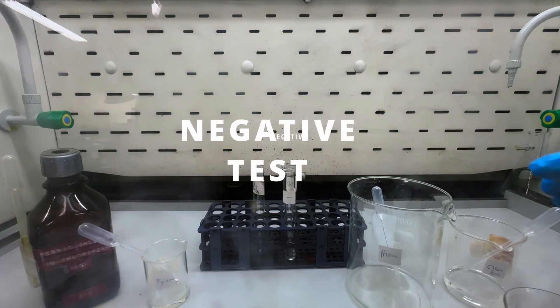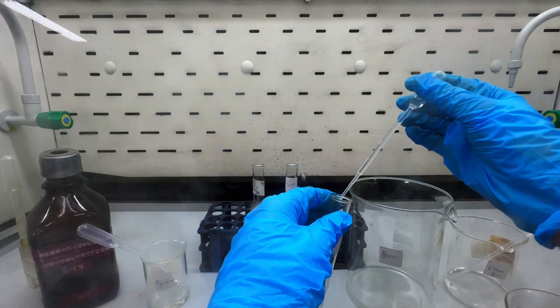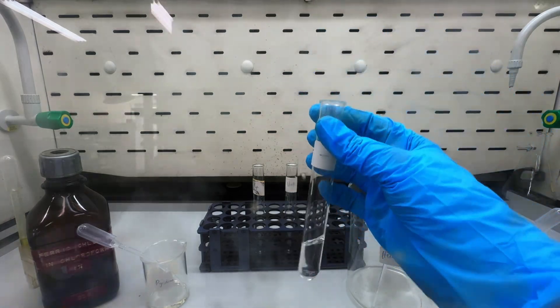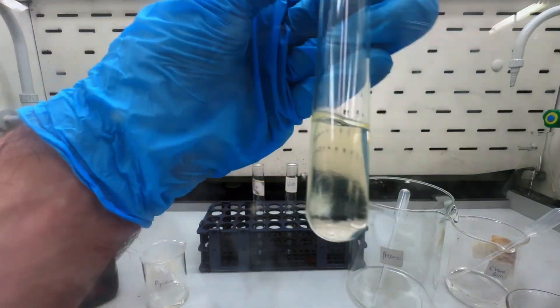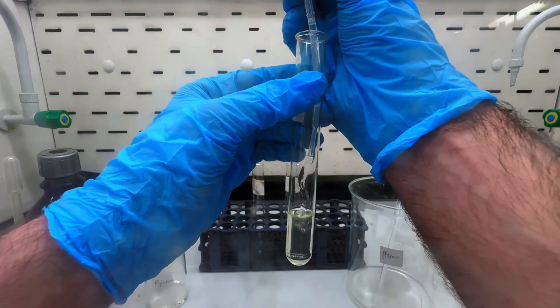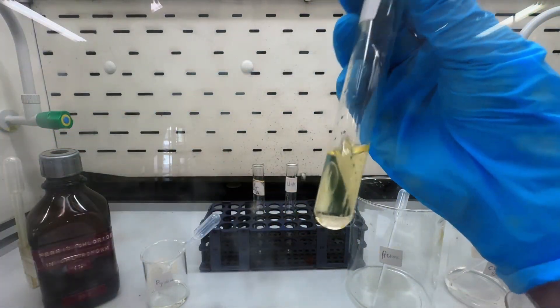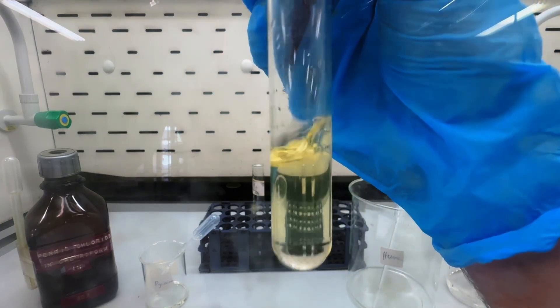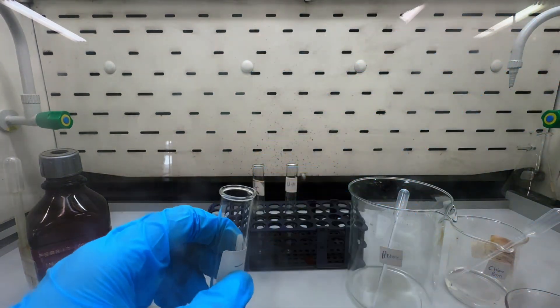For my negative control, my test tube is preloaded with enough chloroform, and I'm adding hexane as my organic compound, followed by ferric chloride and then a few drops of pyridine. As you can probably guess, no color change occurs whatsoever. I'm left with a pale yellow solution due to there being no phenol for the ferric chloride to react with.